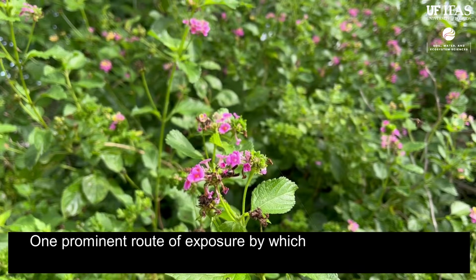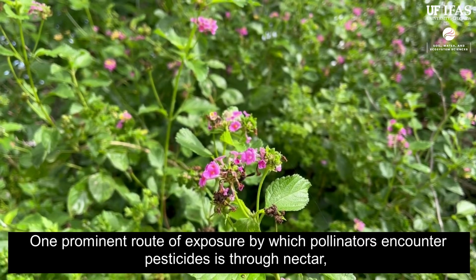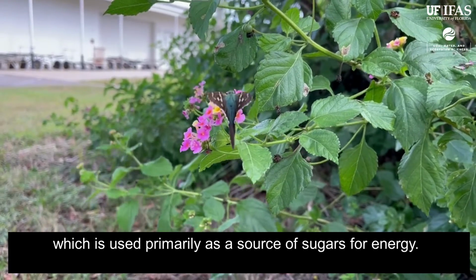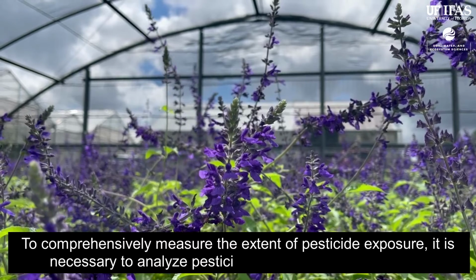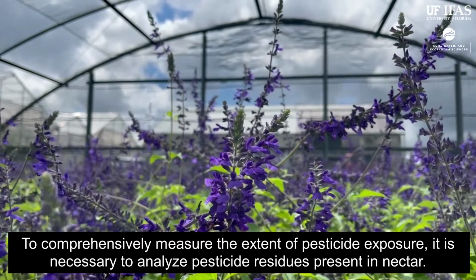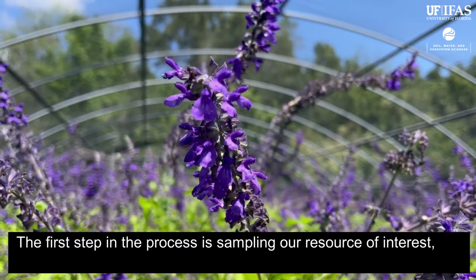One prominent route of exposure by which pollinators encounter pesticides is through nectar, which is used primarily as a source of sugars for energy. To comprehensively measure the extent of pesticide exposure, it's necessary to analyze pesticide residues present in nectar. The first step in the process is sampling our resource of interest, the nectar.